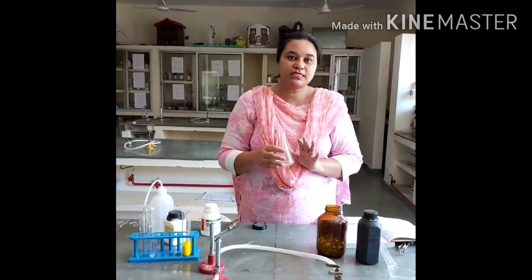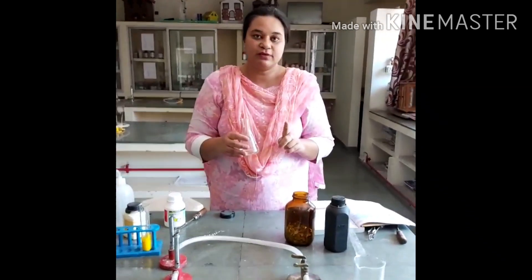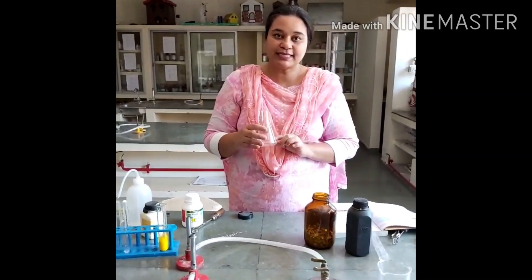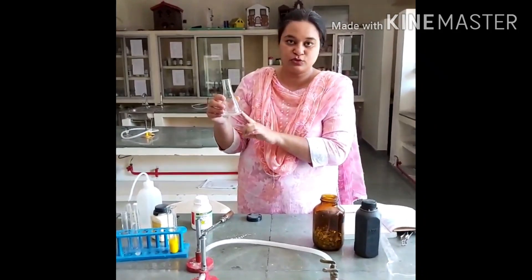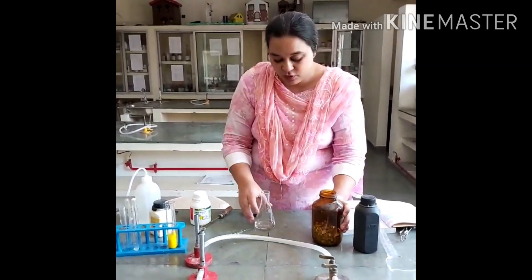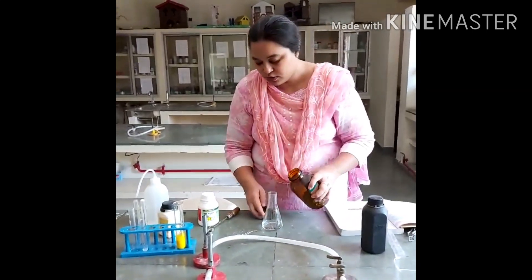This activity will explain Activity 1.3 from the book, in which we are taking dilute HCl — hydrochloric acid — and we have to put in the zinc granules.